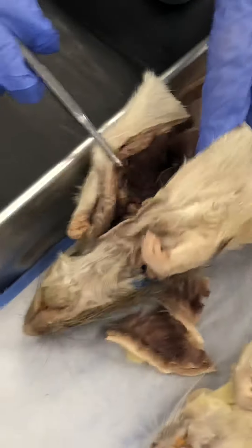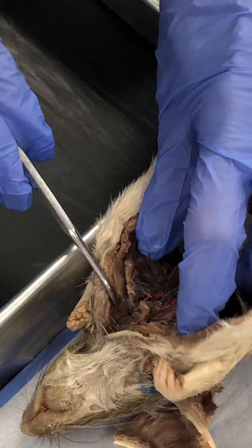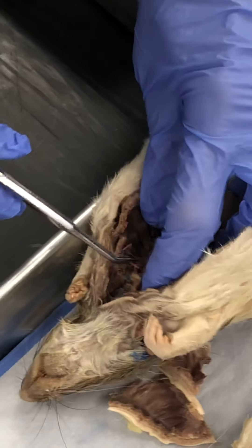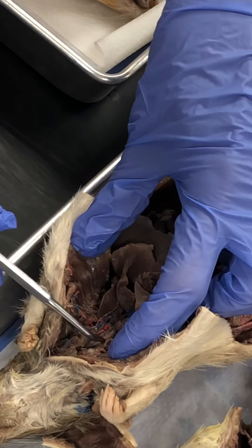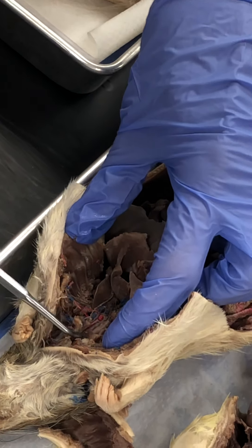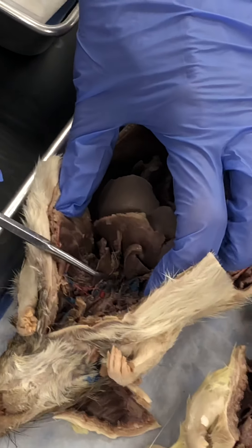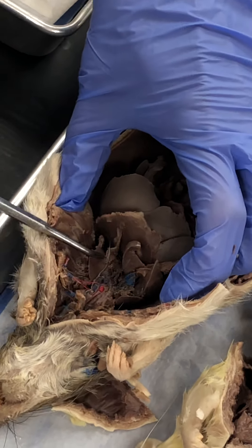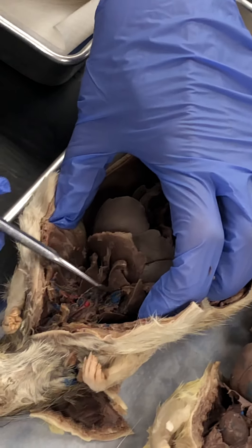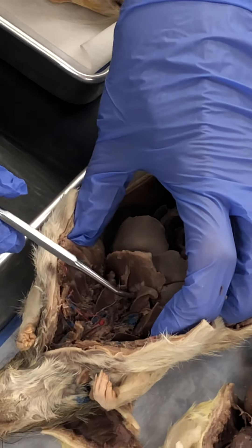You have to know the trachea right here. It splits into the primary bronchi — right there and right there — and then there's the lung.